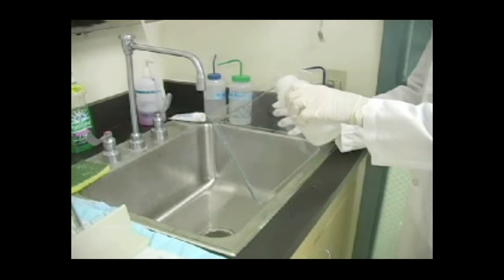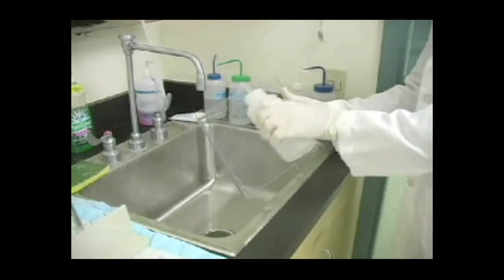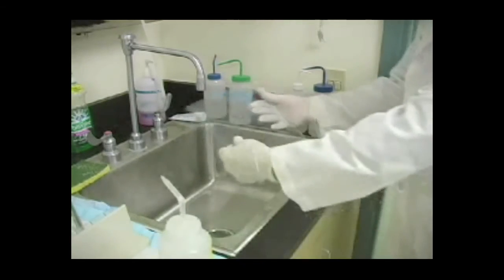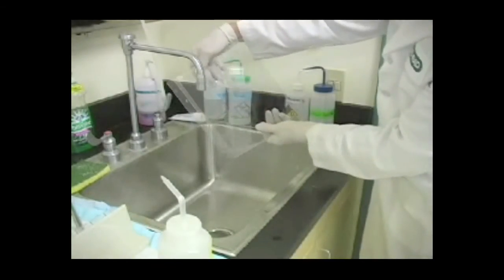Rinse off the tops of all the gels thoroughly with distilled water. Wash off any pieces of excess acrylamide with distilled water.